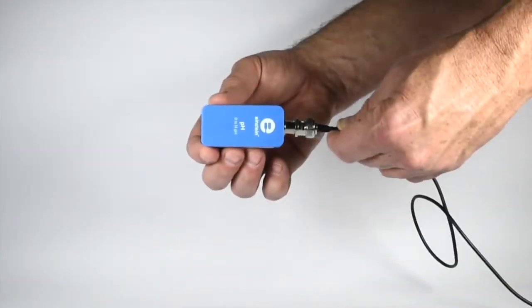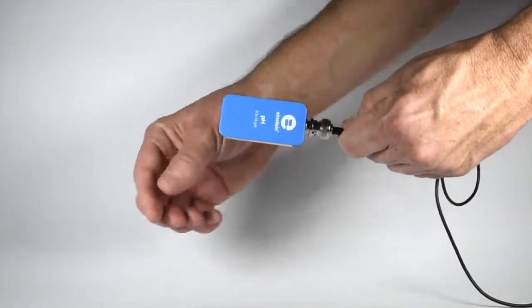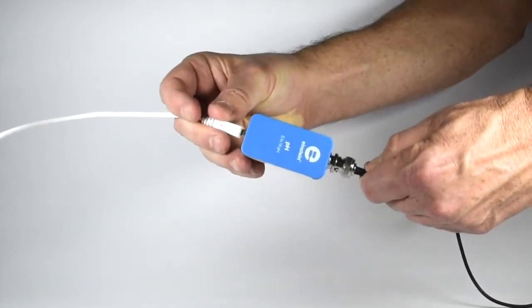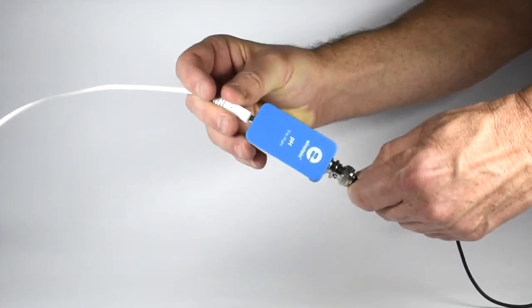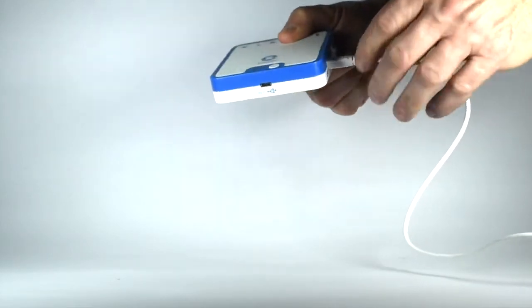To use the pH sensor, first attach the electrode to the sensor, then attach one end of the cable to the sensor and the other to the sensor ports of your Einstein device.